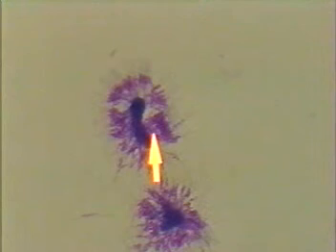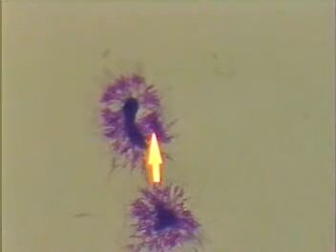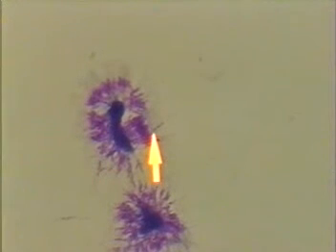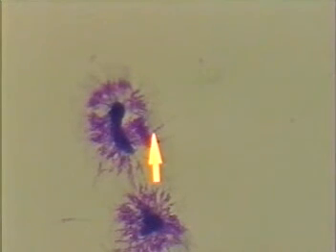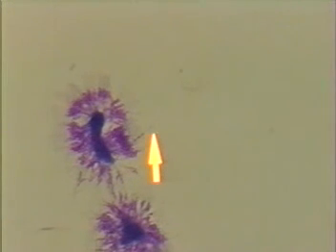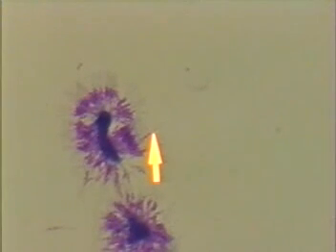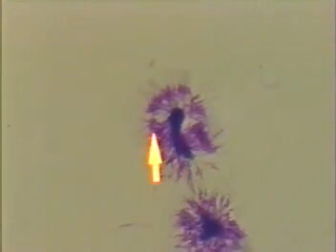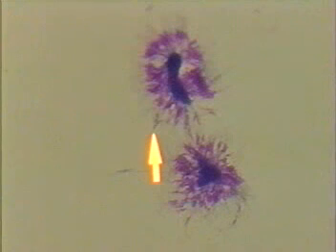The nuclei are associated with each one of these sporozoites — and there are probably several hundred sporozoites here — all stuck to a piece of debris with their anterior ends located towards the center. At the end of the pointer, here's one stuck off by itself. You can see the purple nucleus on one end, very thin, and then the other end without the nucleus appearing less purple. In order to fit several hundred of these into a mosquito salivary gland, they would have to be quite small. This view is seen through the 100x oil immersion lens.